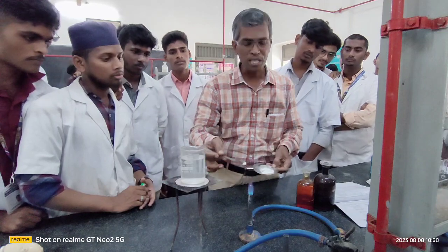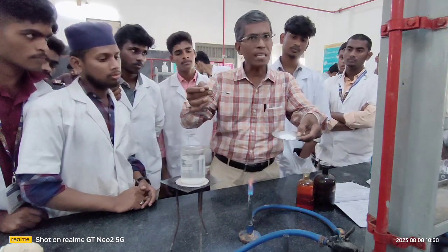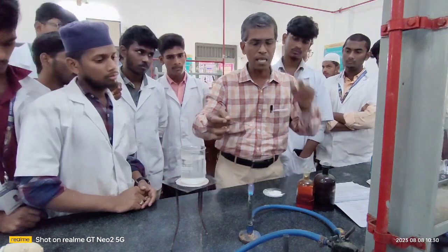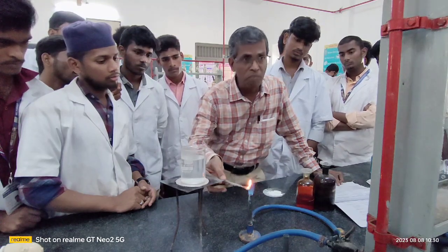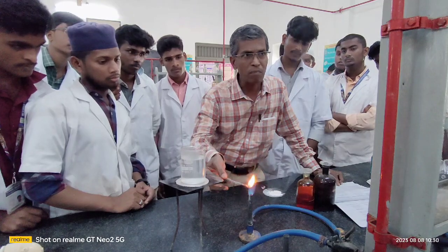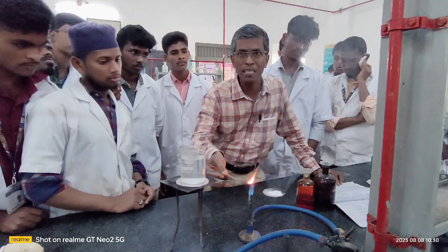Just for your confirmation, just to clear your doubts, take a small amount of your organic substance. The compound taken here is solid. You may get a liquid also. If the compound given is liquid, you take a little amount of the liquid, that is the organic compound, and introduce it very close to the Bunsen flame, that is, the blue edge of your Bunsen flame. It will definitely catch fire and start burning with a lot of sooty flame, with smoke coming out of this flame. This flame is called a luminous flame or sooty flame. See what happens here? This confirms the presence of aromatic in the given compound.